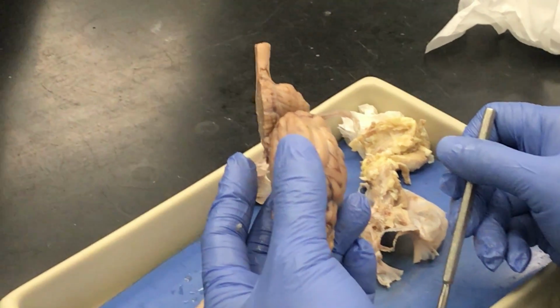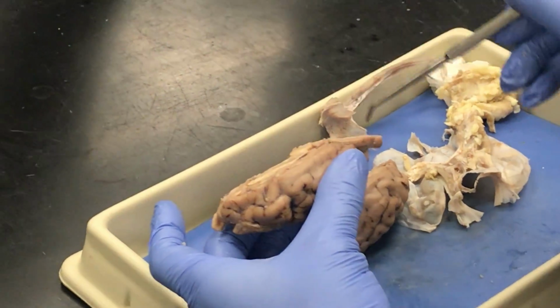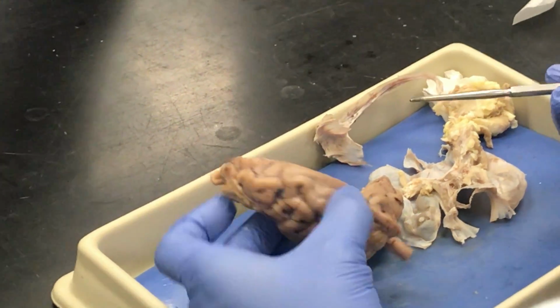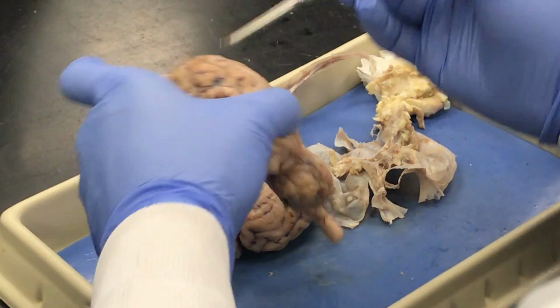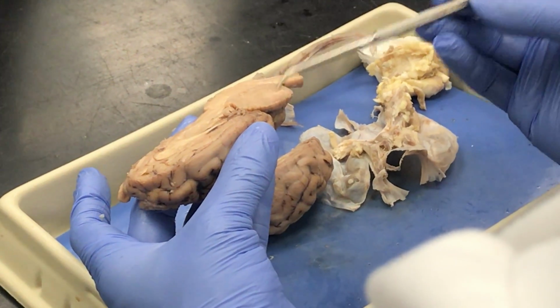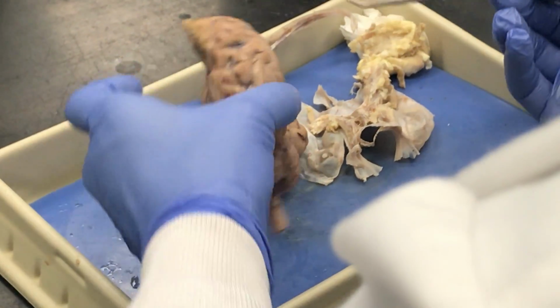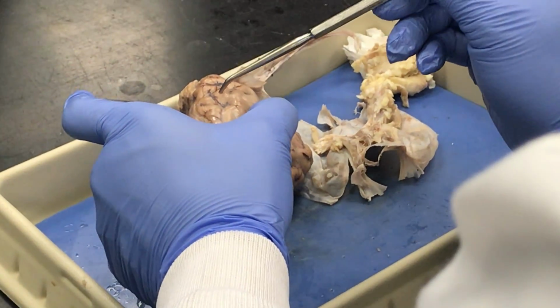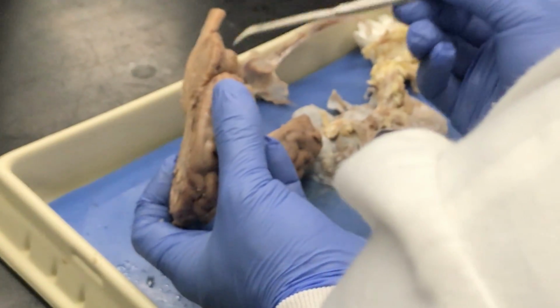Cerebral cortex and cerebellar cortex. So that's just distinct. Neural cortex can be applied in both areas. The gray matter at the surface of the cerebrum is cerebral cortex. Superficial gray matter over here is cerebellar cortex. And then the distinction between folia and gyri. Gyri are only on the cerebrum. Smaller bumps on the cerebellum are called folia.